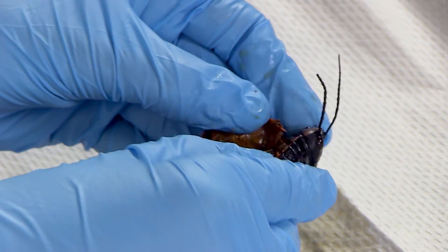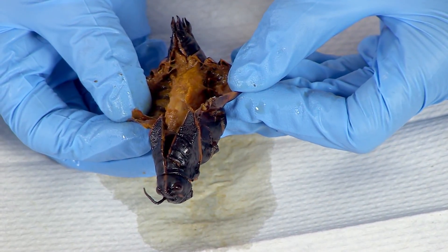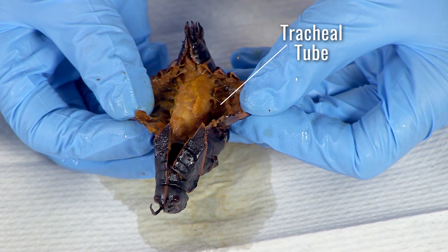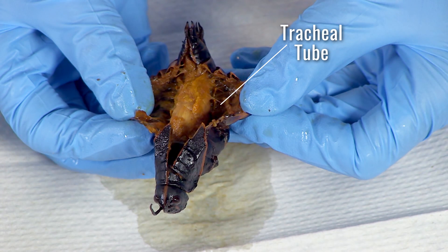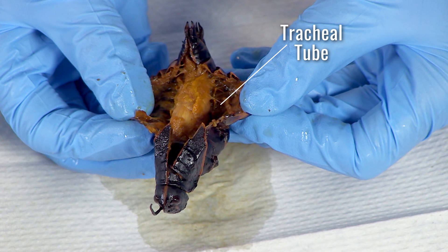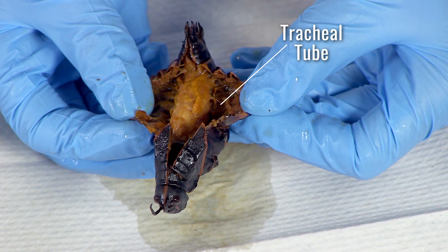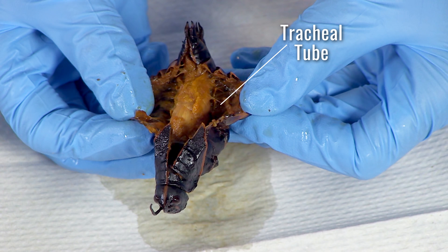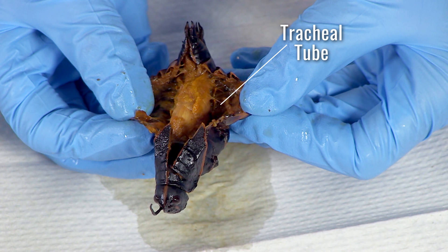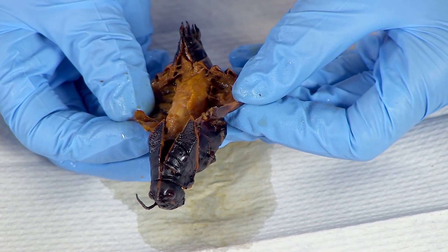Observe any segmentation patterns found within the grasshopper. Tracheal tubes appear as fibers extending from the body of the grasshopper to the exoskeleton. These are air tubes used in respiration and function to exchange gases between tissues and the surrounding air. The tracheal tubes connect to the outside via the spiracles. Take an image and label the tracheal tubes.